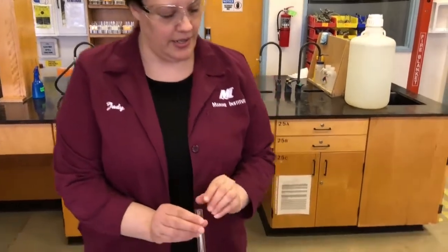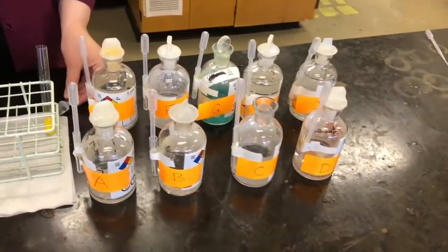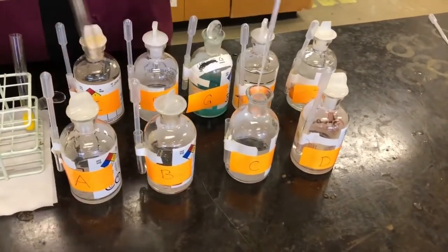Our observations are exactly what we see: it turned yellow and formed a solid. Our deduction is that they reacted to produce that solid yellow product. That's the difference between observation and deduction. Now we're going to do the same thing with all of the other solutions. We're going to follow along with our table again. The next one is C plus D, and your lab manual specifically asks you to look for a smell or an odor.